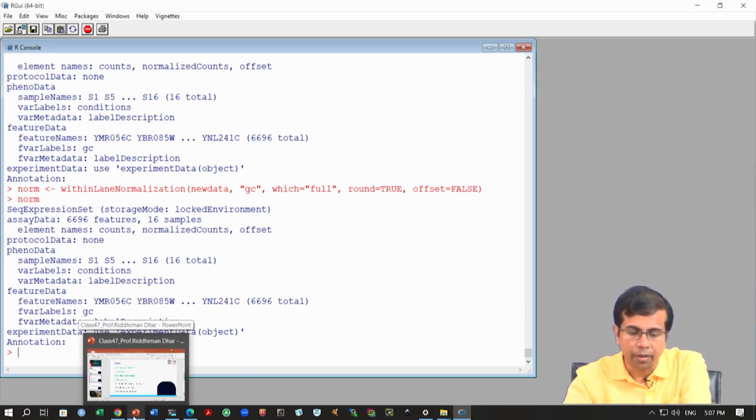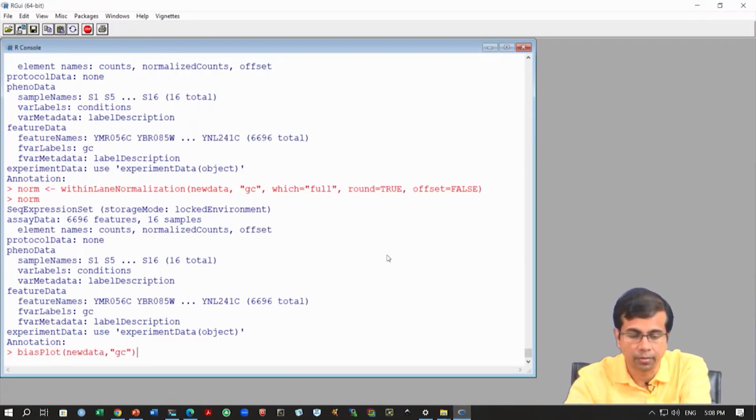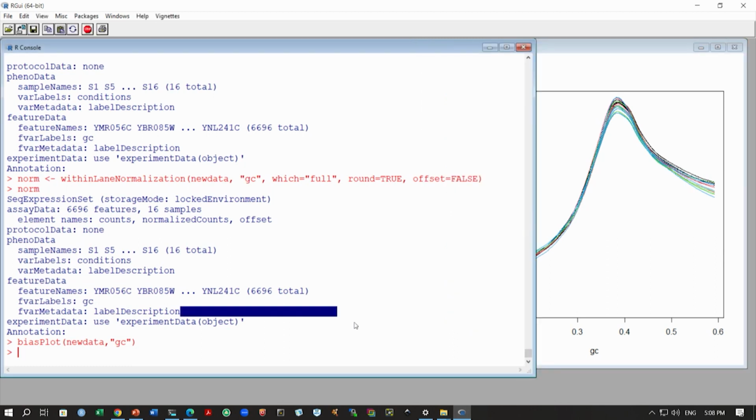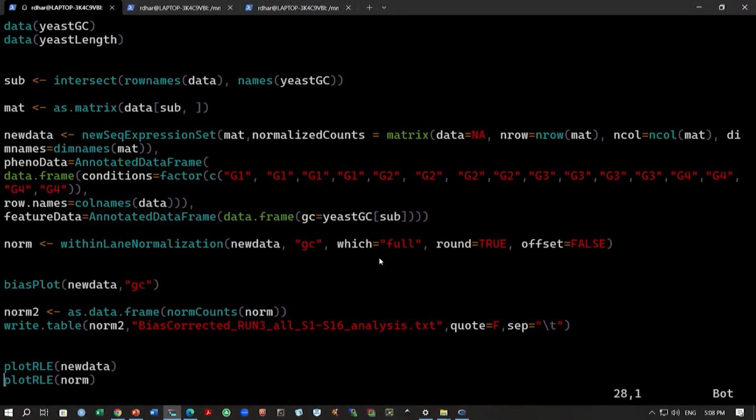Okay. So, how do you actually look at the bias? Okay. So, whether there is any bias or not. You can see this by using this command bias plot. Again, this is part of this package. There are other plotting functions also, and you can use this, and this will give you the bias plot. So, this is the GC content and the gene counts, right, based on this bias plot. Okay. So, of course, gene counts cannot be negative. So, there is some sort of scaling here. Okay. So, this is how we can check this. Now, what we will do is we want to export this data, right.